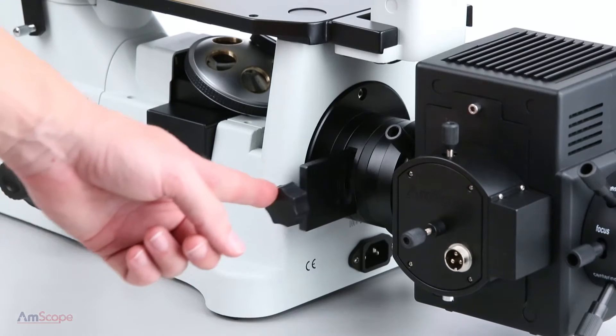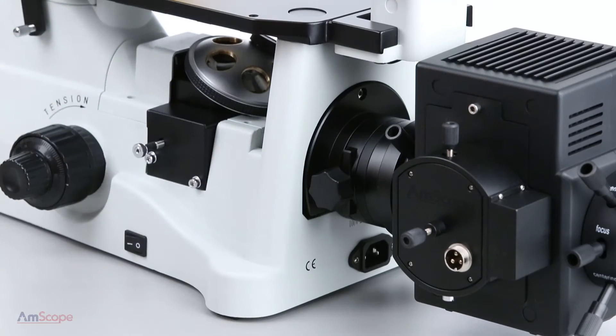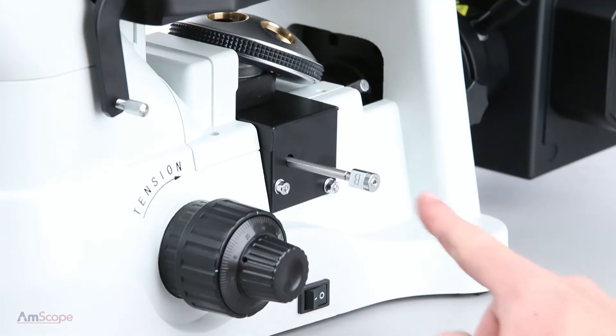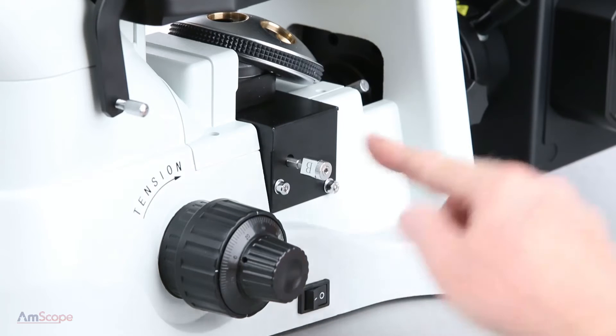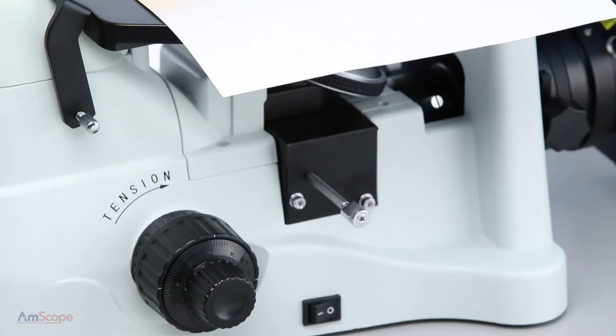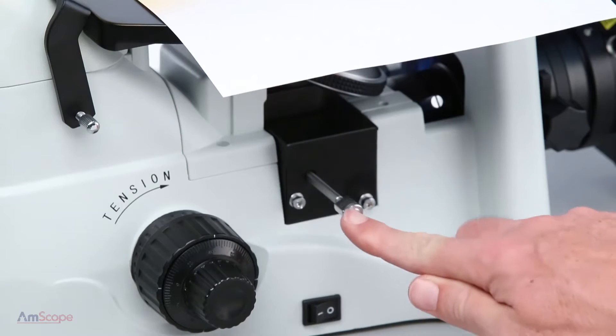Adjust the shutter board so that the light can pass through. Move the blue filter block into place by pushing its appropriate rod. With the light on, the effect is noticeable right away.